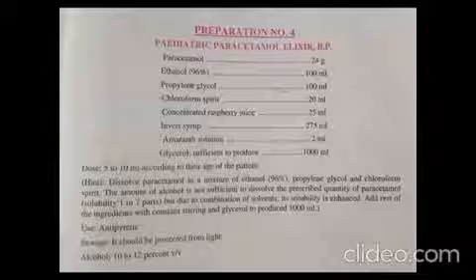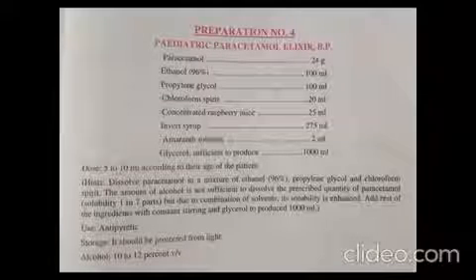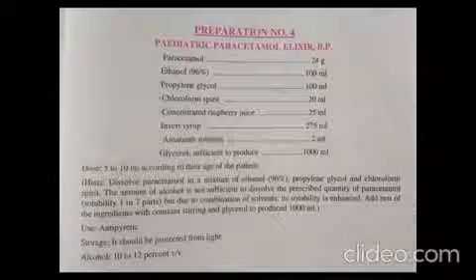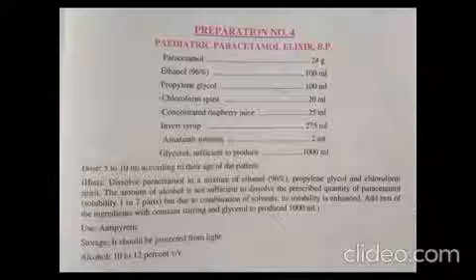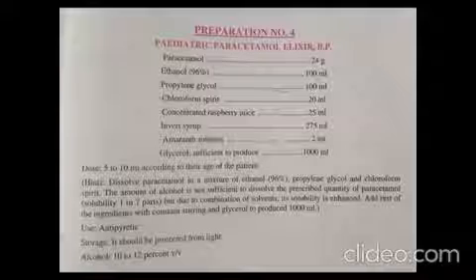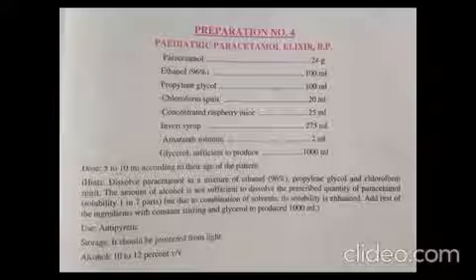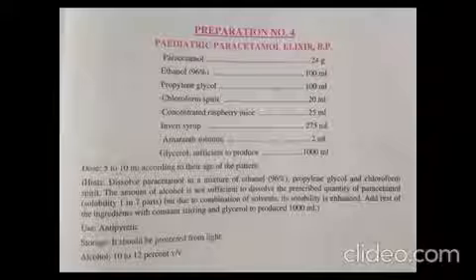We have to dissolve paracetamol in a mixture of ethanol (96%), propylene glycol, and chloroform spirit. The remaining ingredients — glycerol, concentrated raspberry juice, chloroform spirit, invert syrup, amaranth solution, and propylene glycol — are added with continuous stirring, and the final volume is made up using glycerol.